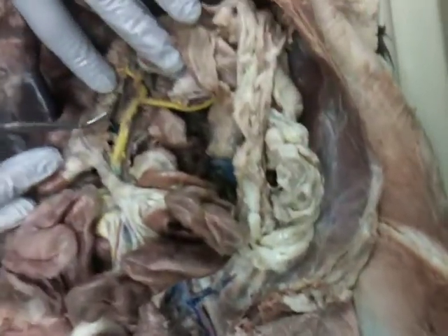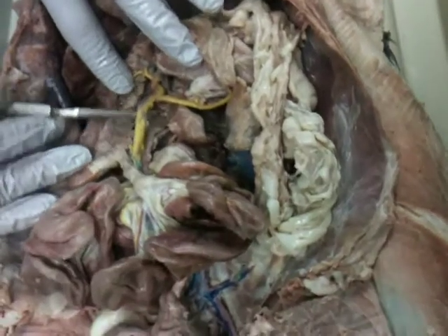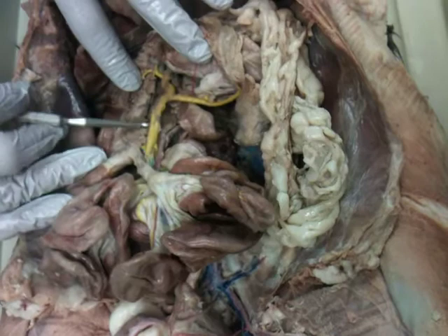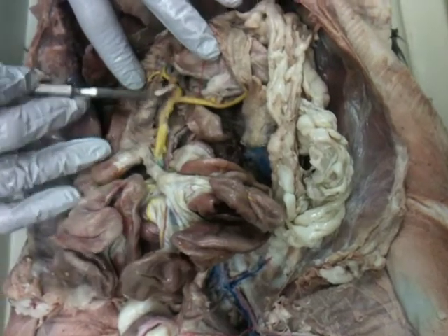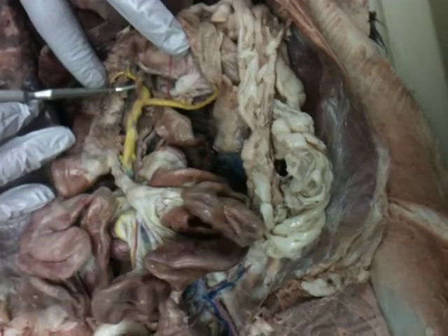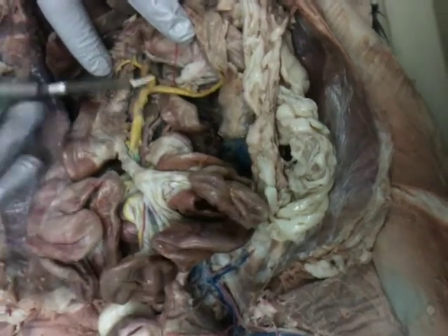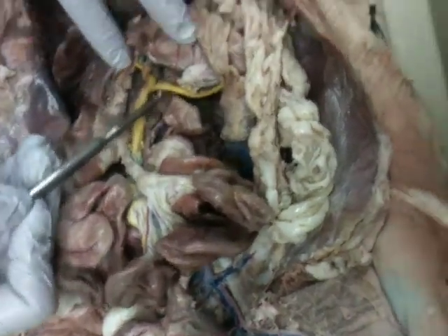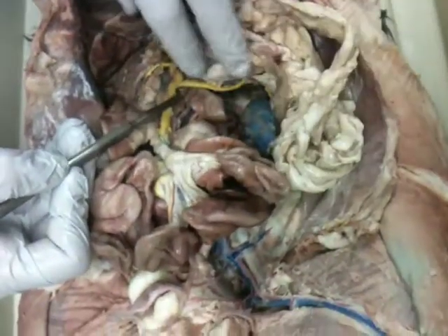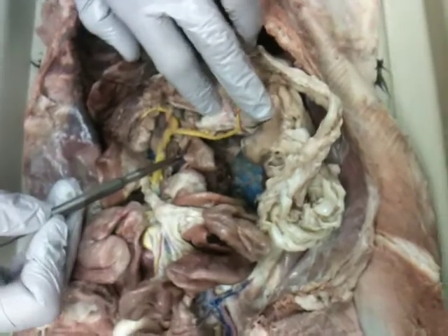So down here, one of the main ones you'll see is this. What's that? Superior mesenteric vein. The superior mesenteric vein drains into the big guy, the hepatic portal vein. You have to get the portal in there. Good. And this guy, gastrosplenic, because guess where it goes? To the spleen and the stomach. It tells you where it goes.